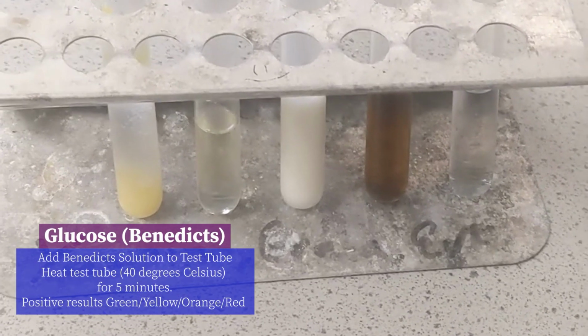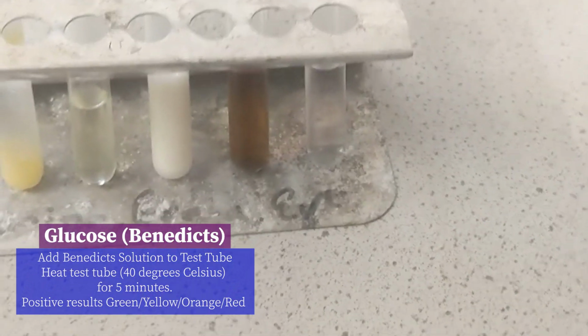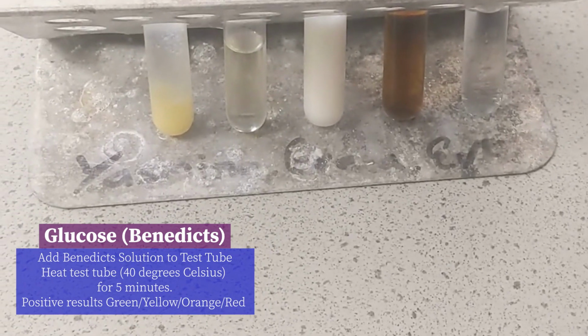So when we're doing a test, we take our Benedict solution, which looks blue, we add it to a test tube mixed with the solutions we're trying to test.